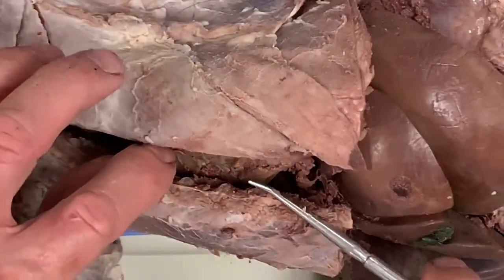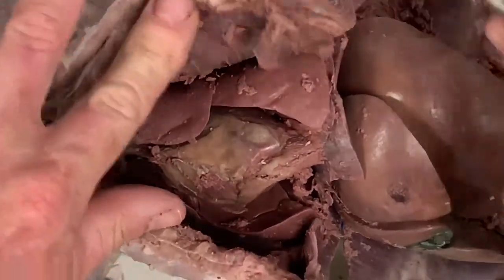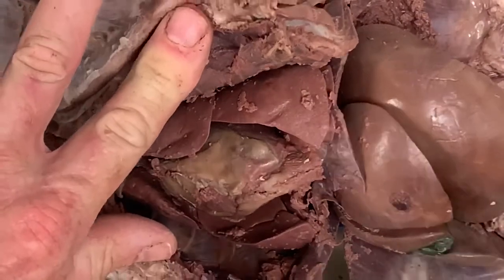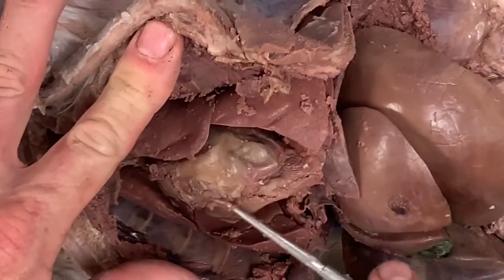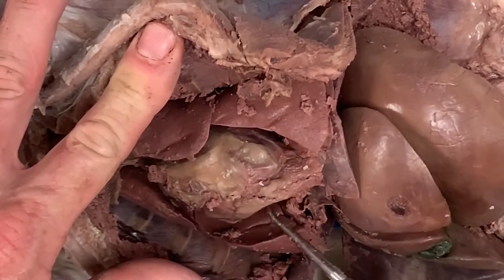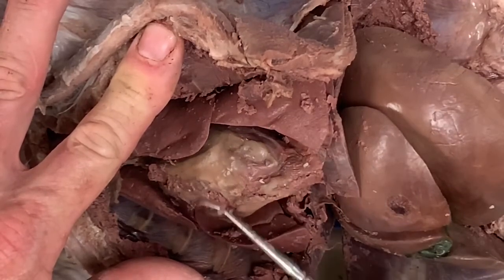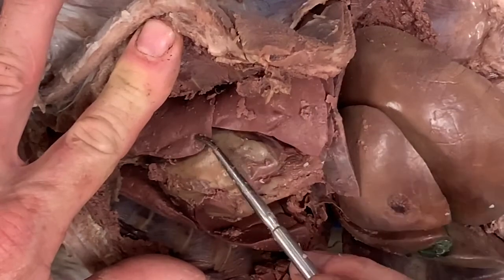The last thing I wanted to show you is in the thoracic cavity. You can see the ribs right here. You can see the diaphragm. And then this is the heart. Surrounding the heart is the pericardium. It's loose connective tissue that helps to prevent the heart from abrading, the tissue from getting damaged from the beating process. Here are the left lungs.